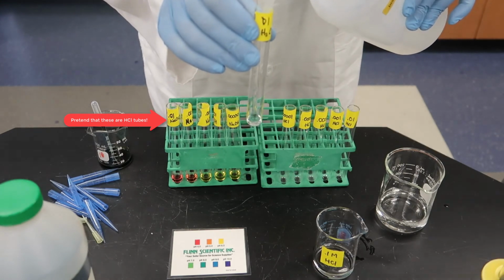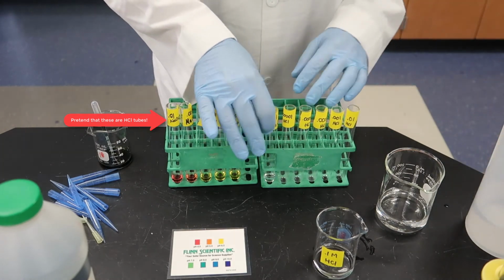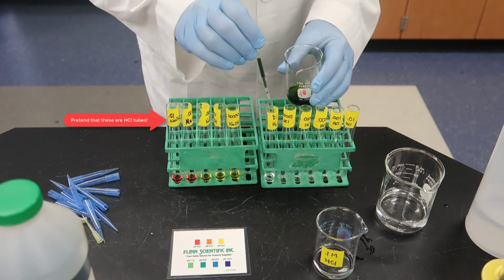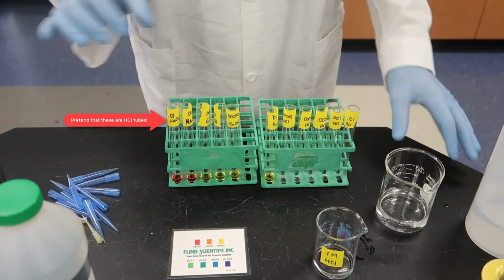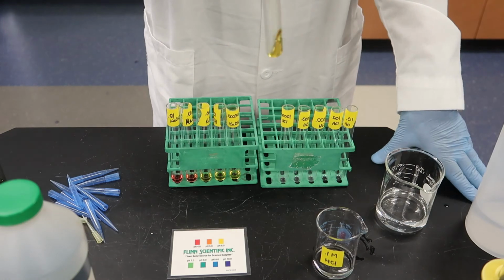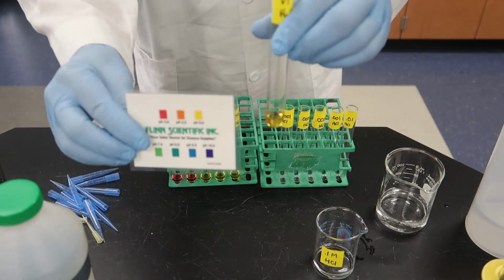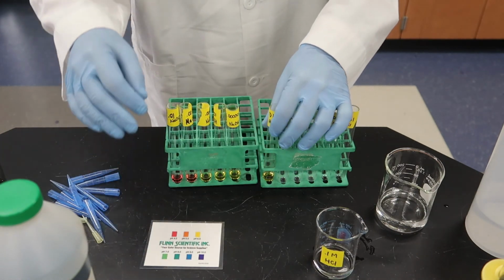Hopefully you know at this point that a pH of 7 is neutral. So in this tube, we're just adding some water and a little bit of the universal indicator to see what just plain old water looks like. And I have to be honest with you here, it's a little more yellow than it should be, and I'm just not really sure why. I don't know if that's because maybe the tube was a little contaminated. It should be more of a green color.